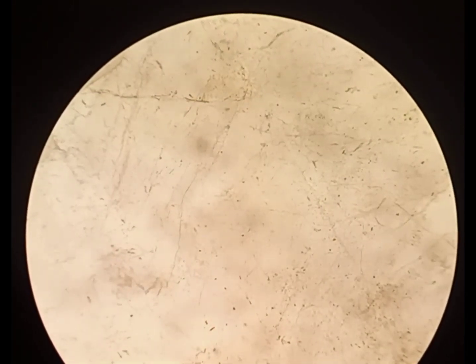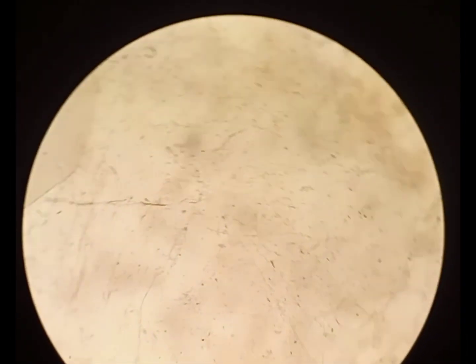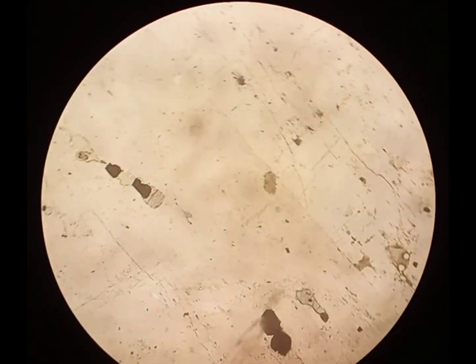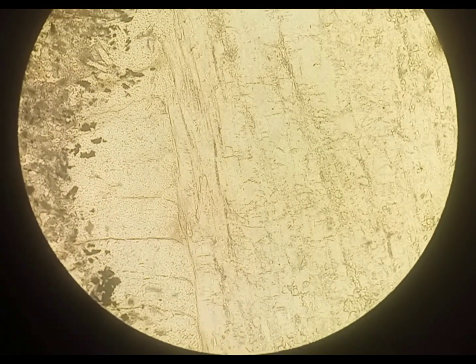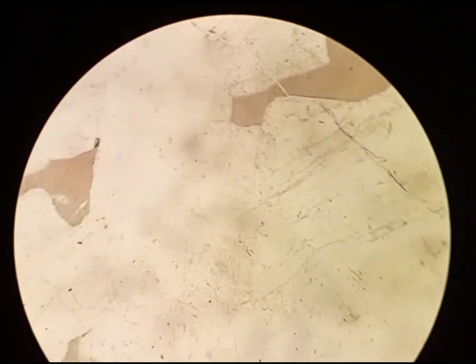When we observe feldspar in plain polarized light, it is a low-relief mineral, but its relief is slightly higher than quartz. It remains colorless and non-pleochroic in plain polarized light.